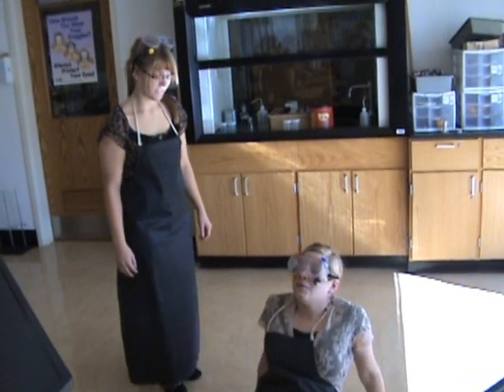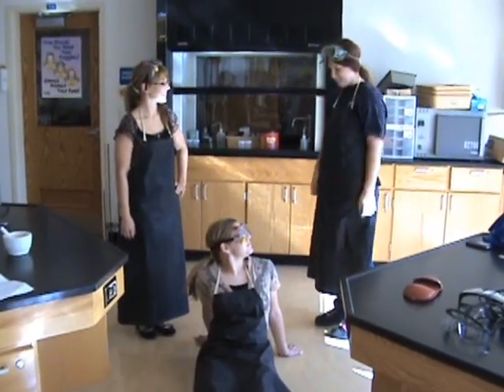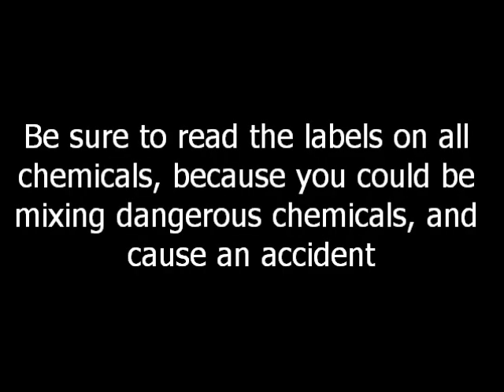Whoa, what happened? Didn't you read the labels? Be sure to read the labels on all chemicals, because you could be mixing dangerous chemicals and cause an accident.